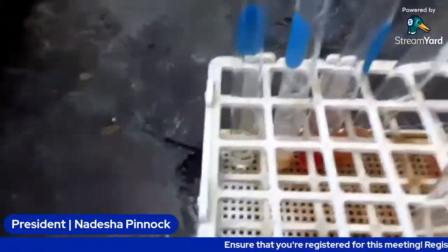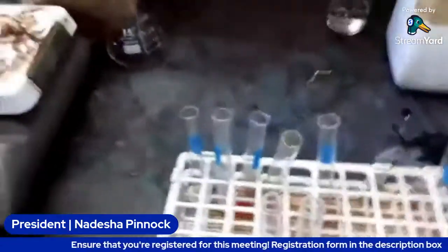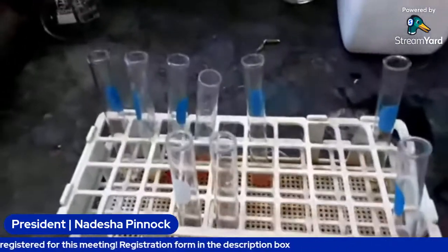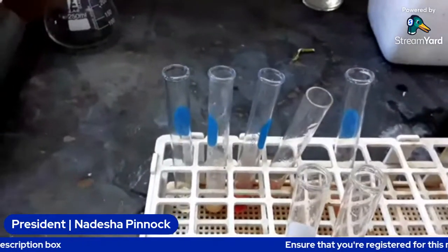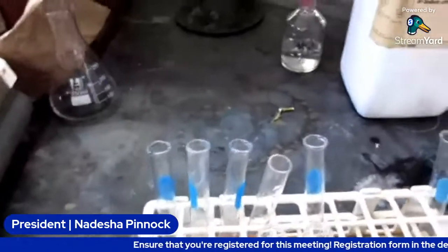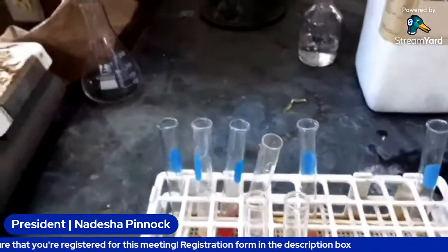And then for the sucrose, we try it with the acid, because we did say that glucose is a monosaccharide and sucrose a disaccharide, but it is not a reducing sugar. But we're going to do the complete test for you guys.